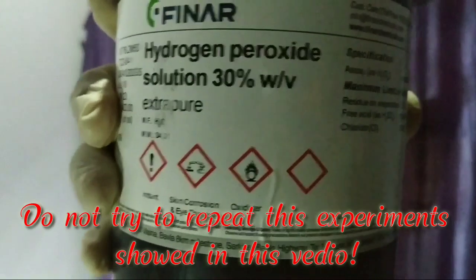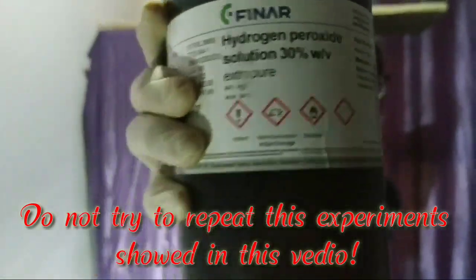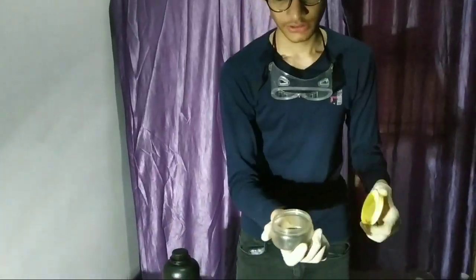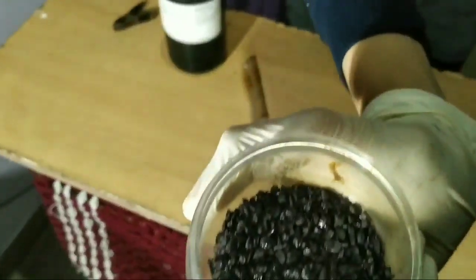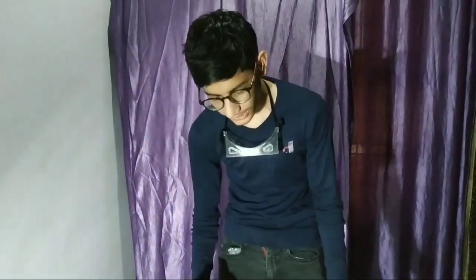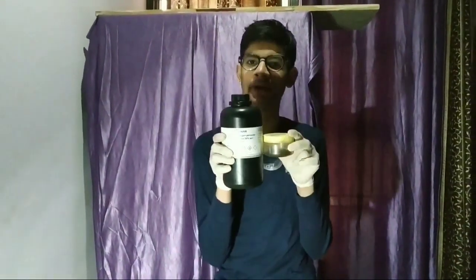So guys, this is hydrogen peroxide 30%, and this is potassium permanganate — basically these crystals are potassium permanganate. What happens if we mix them together? Hydrogen peroxide and potassium permanganate are both strong oxidizers. Today's video we are going to mix them together. This is Curiosity Science, so let's start.